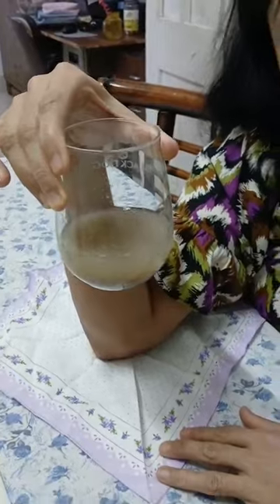So I'm back with a new topic of separating mixtures. In today's video, I'm going to cover sedimentation, decantation and filtration. I know many students face problems in understanding the scientific concepts, right? But science is not just rote memorization, it is also learning by doing. So today I'm going to explain the concept of sedimentation, then decantation and then filtration.